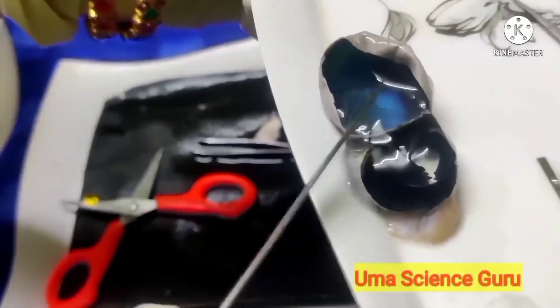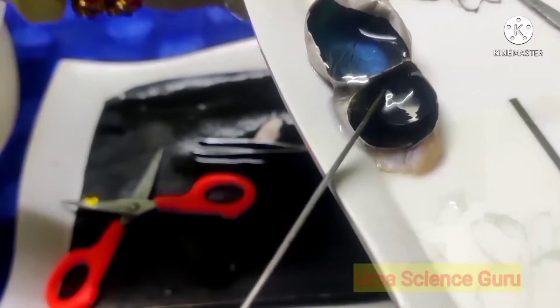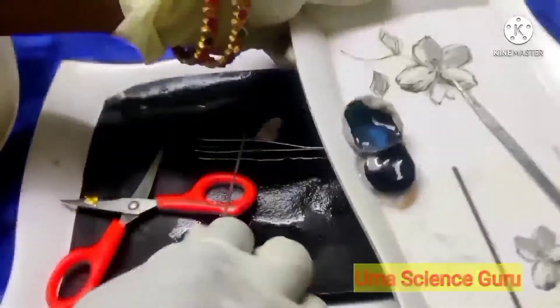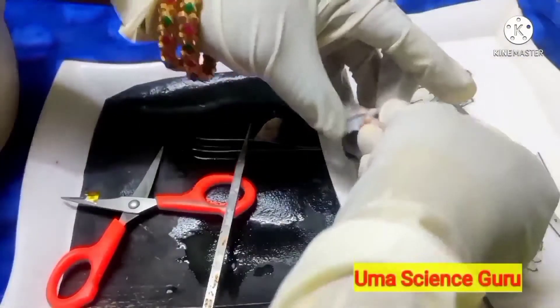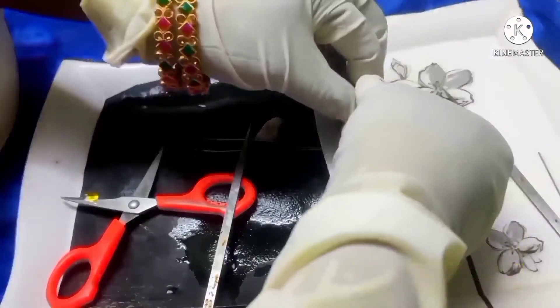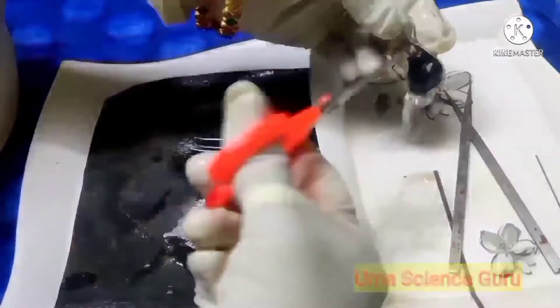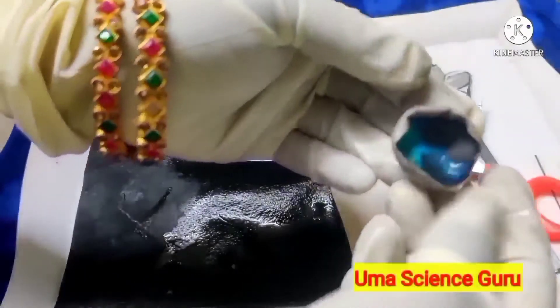Observe the retina, the innermost layer — the blue-colored layer. Students, I am trying to separate each and every part of the eye. First, separate the jelly-like fluid from the vitreous chamber and the watery fluid from the aqueous chamber. I have successfully separated the innermost layer — the retina.